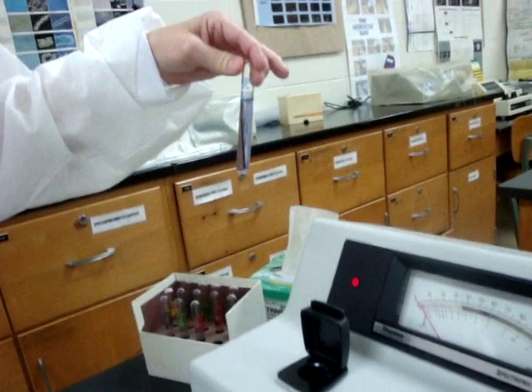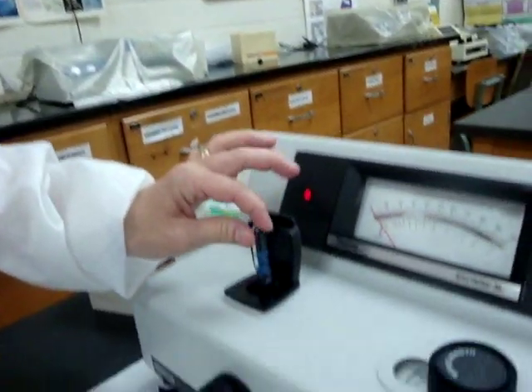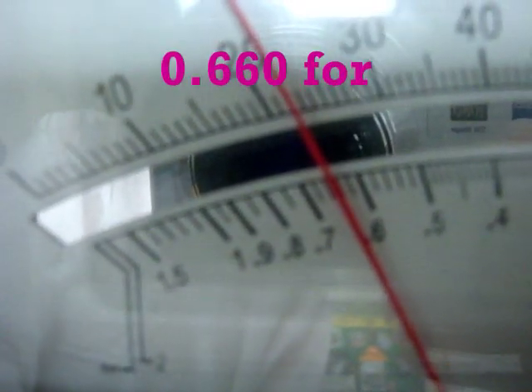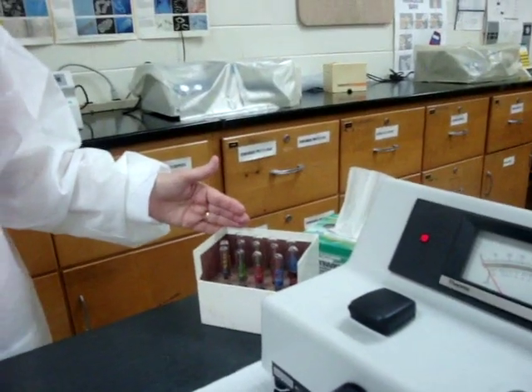Open the lid, place the 0.75 back, and pick up the 1.0 concentration. Wipe fingerprints, place it in the compartment, close the door, and take a reading. The reading is 0.66, which falls within range — the 1.0 concentration should be between 0.602 and 0.824. The 420nm function test is complete. Now it's your turn to do the 520 and 670 function tests. Good luck.